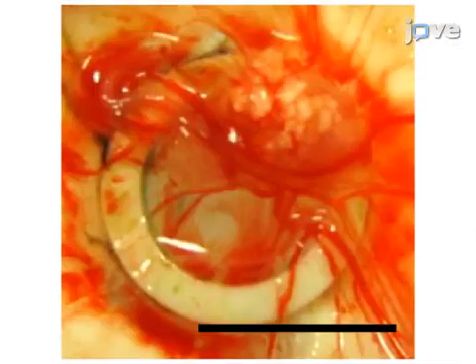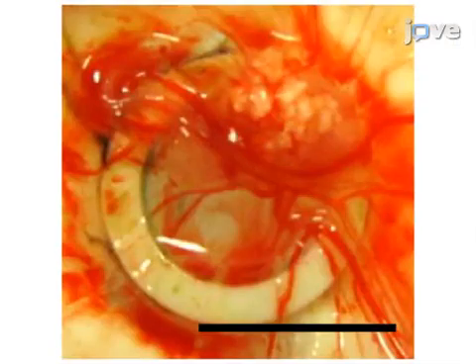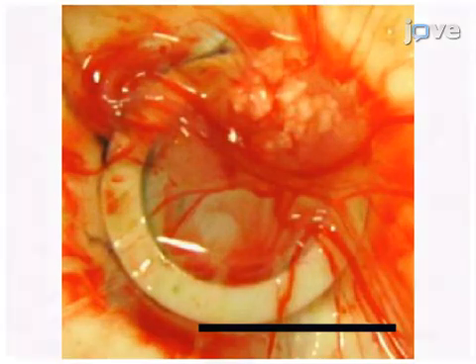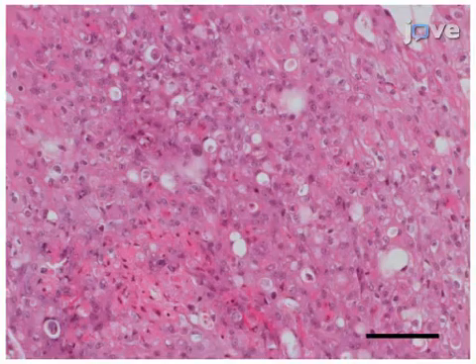The results show that three-dimensional vascularized tumors were successfully grown using human hepatocellular carcinoma cell lines. Using this protocol, embryonic survival rates of up to 93% were achieved.